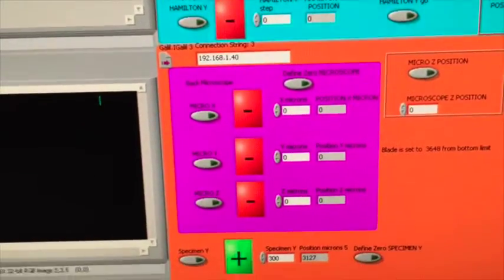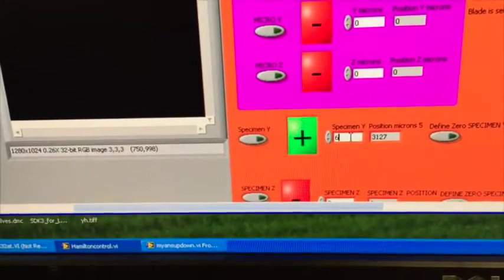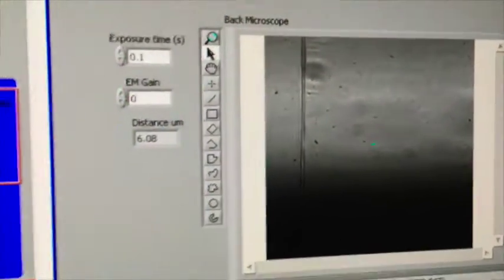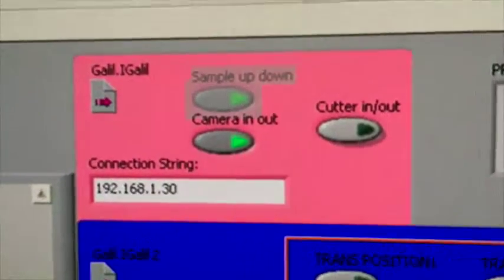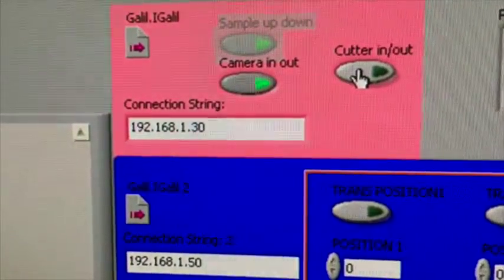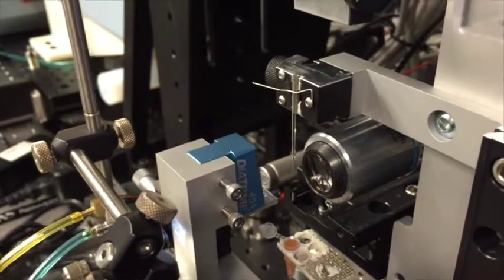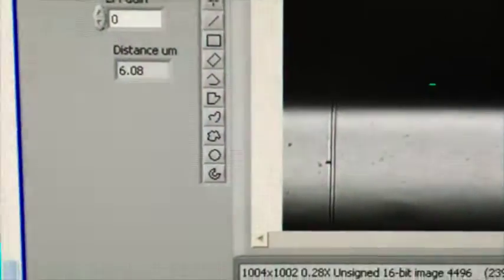to go. The way we do that is we're going to bring the clipper in, and in order to do that, I'm going to pull my tip up and out of the way to make sure it doesn't break when I don't want it to. So I usually hit 600 twice, and there we go. And now I'm going to bring the cutter in by clicking right here. When I click right there, you're going to see that blue diamond thing come in. And there it comes in. We also see that this thing up here, this black, that's our cutter. There's our tip.